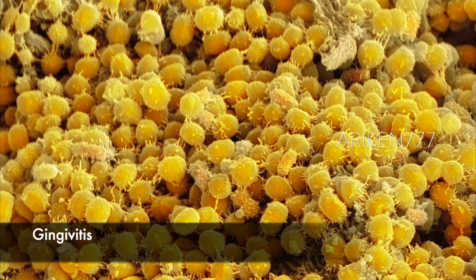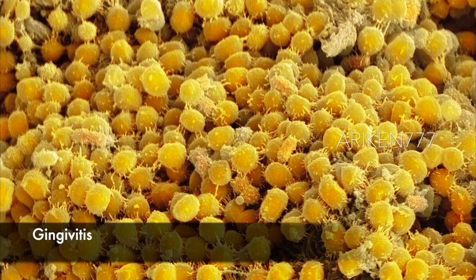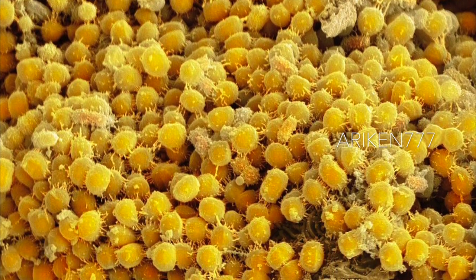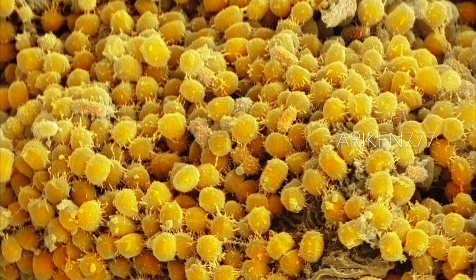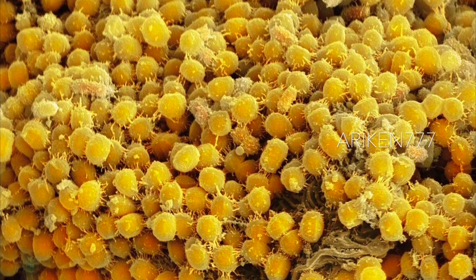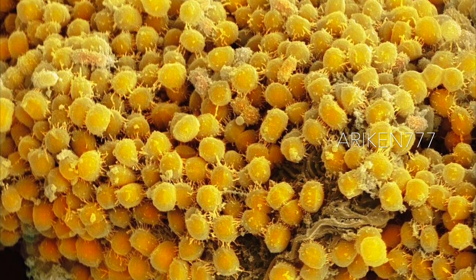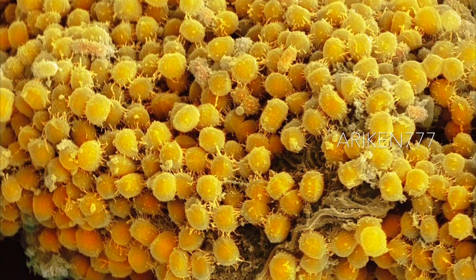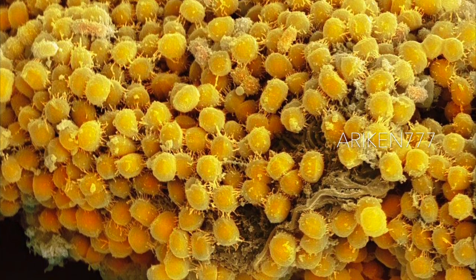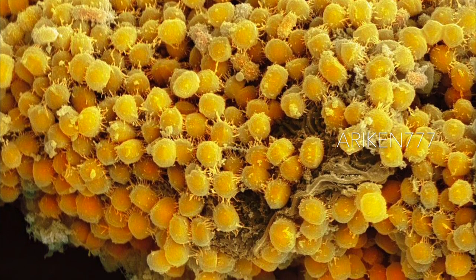A large number of gingivitis bacteria in the gums of a human mouth. The most common form of gingivitis — inflammation and redness of the gum tissue — is in response to bacterial overgrowth that causes plaques to form on the teeth.